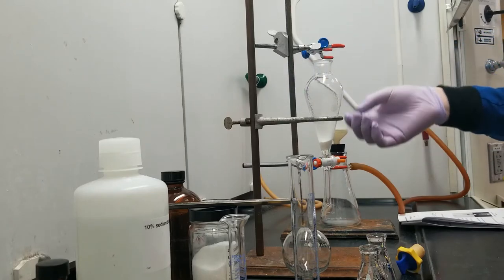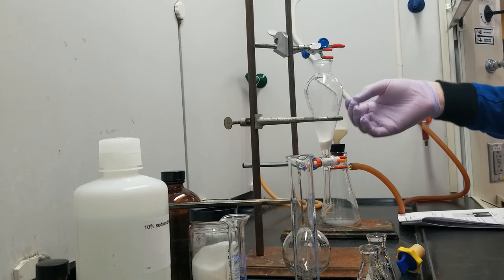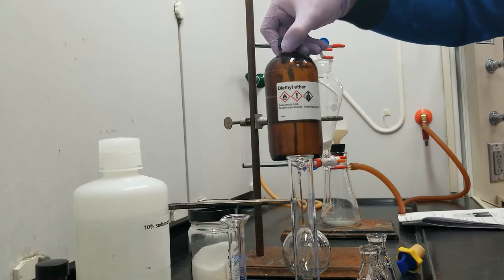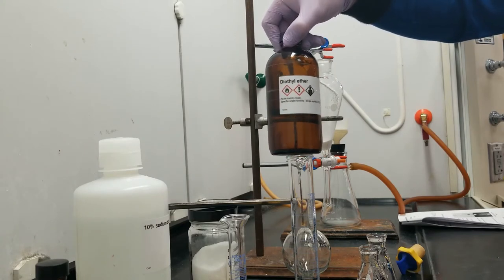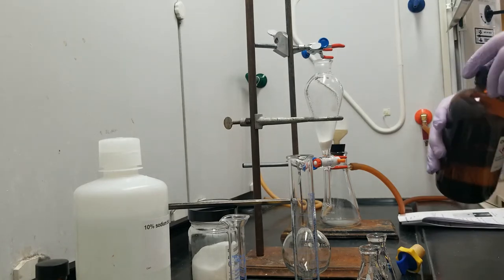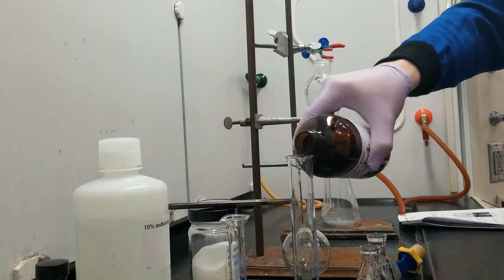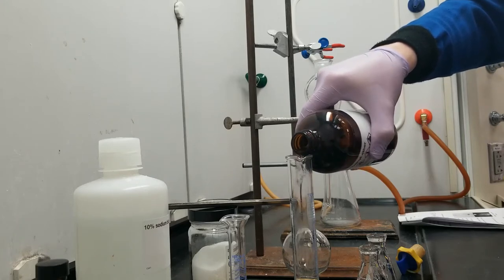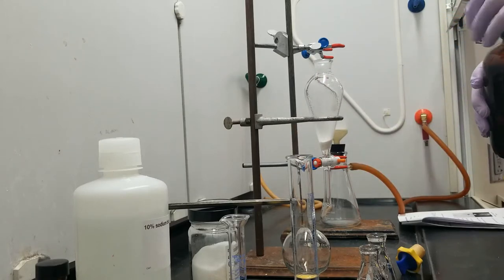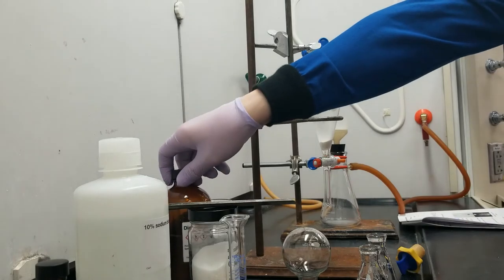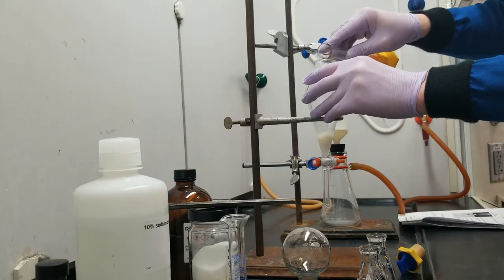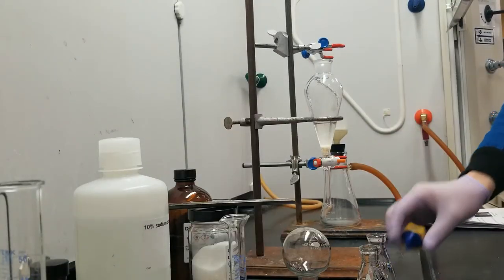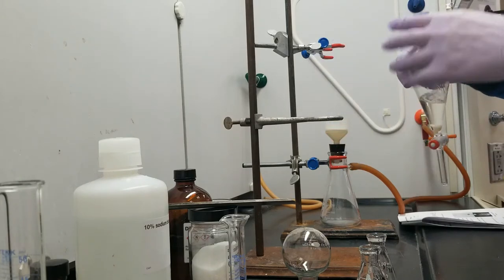The 3-chlorobenzoic acid is currently protonated. So when I add a solvent just to get everything dissolved, I'm going to use diethyl ether. Both components are going to dissolve into it. So I'm going to use 20 mls of this. In order to agitate this to dissolve it, I'm just going to shake.